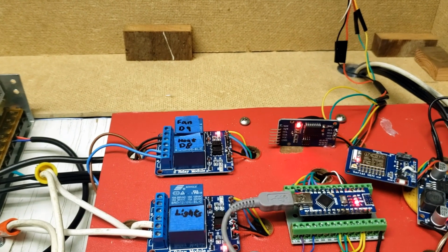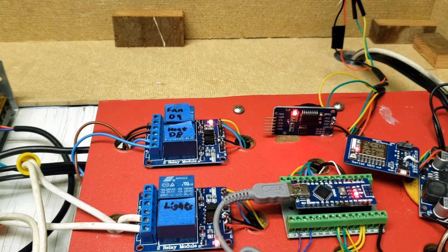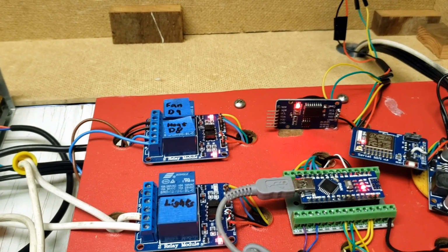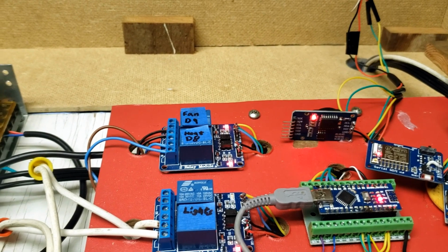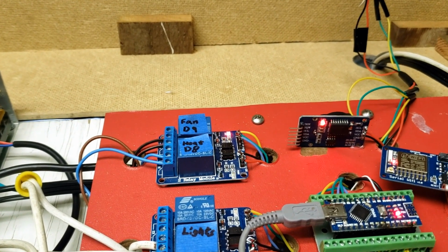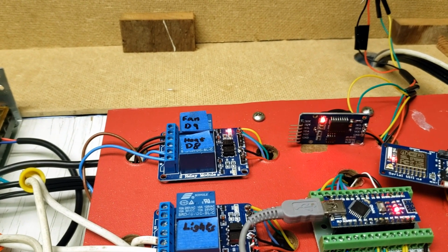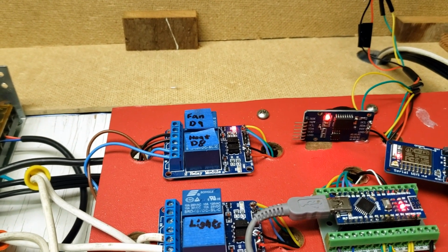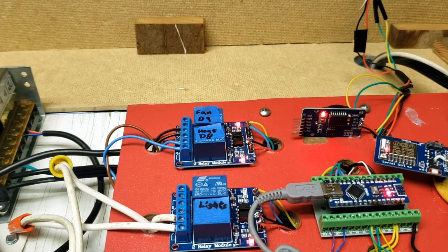The reason I have that is so hot spots don't form inside the chamber. It'll heat up for 10 seconds and then it will allow the fan to mix the hot air. I found hot spots were forming if I just left the heater on all the time when I needed to warm up, and my overshoot was too much, so I was getting too hot too fast. So this allows much finer control with just this on and off setup I have.